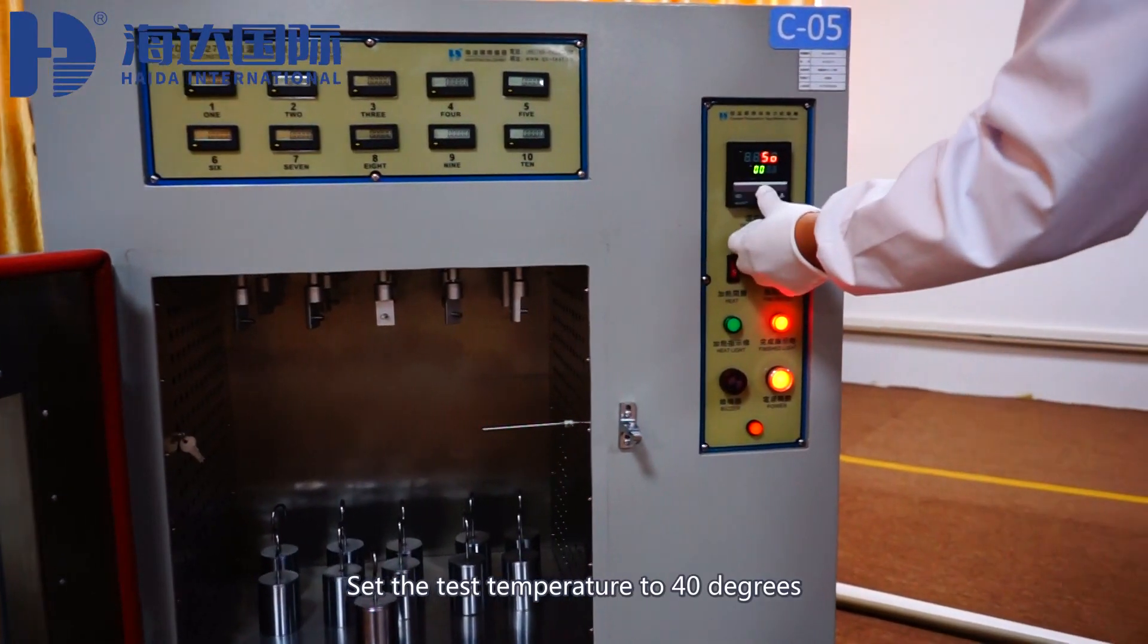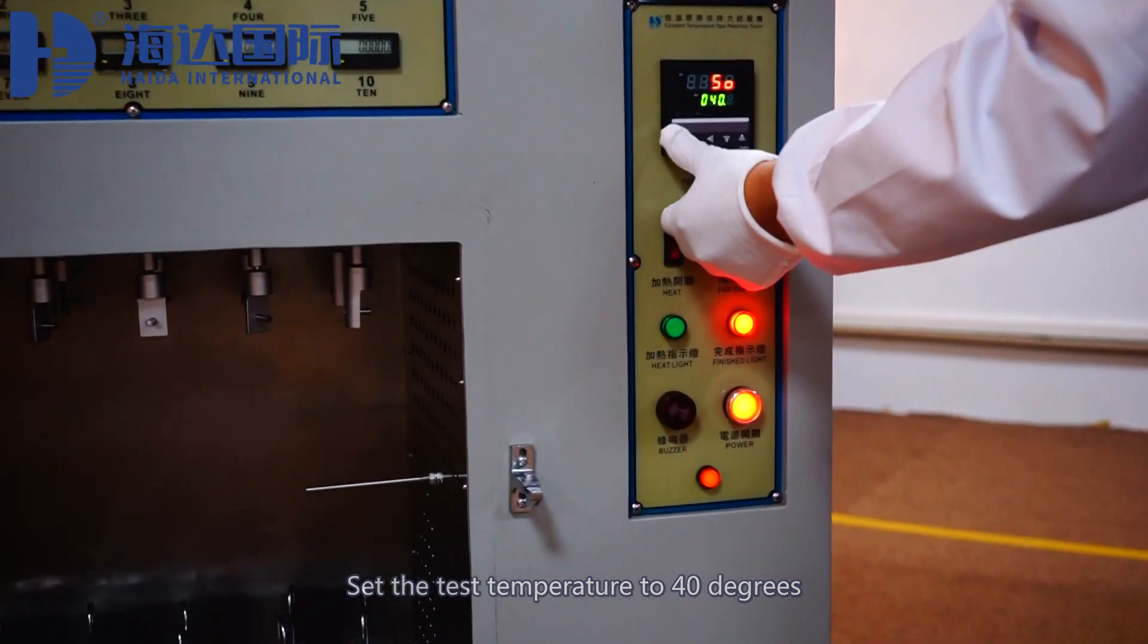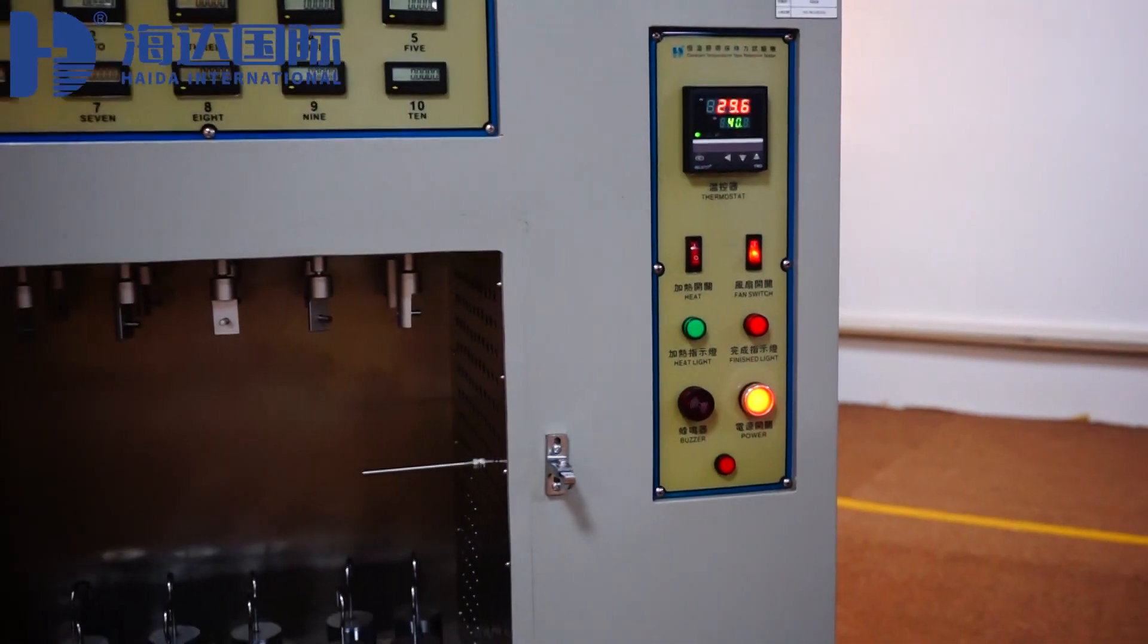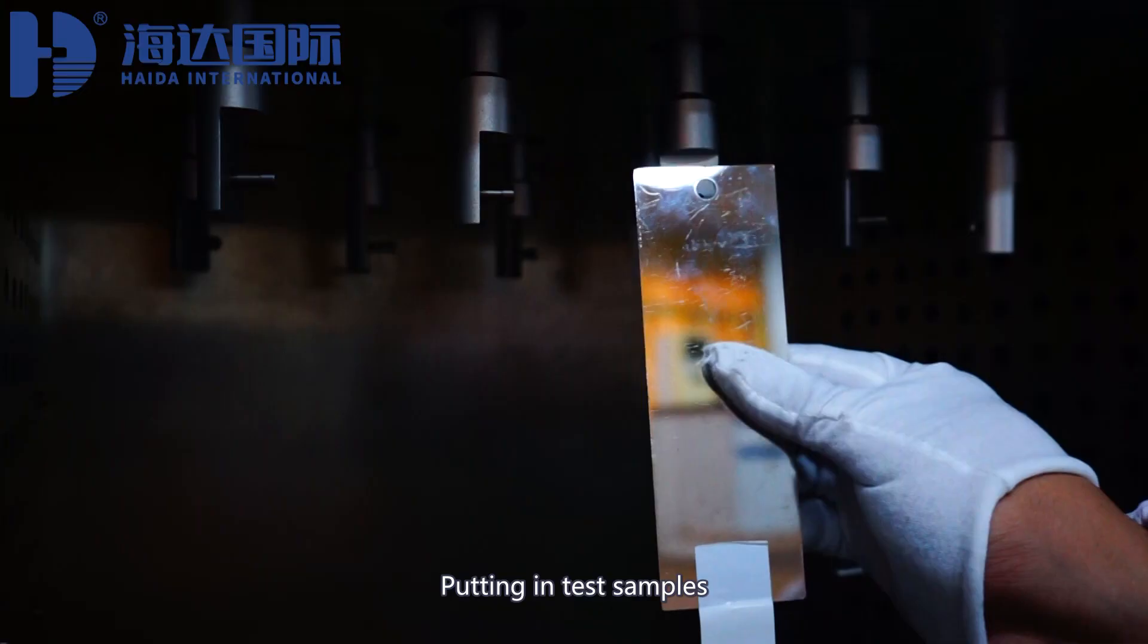Set the test temperature to 40 degrees. Putting in test samples.